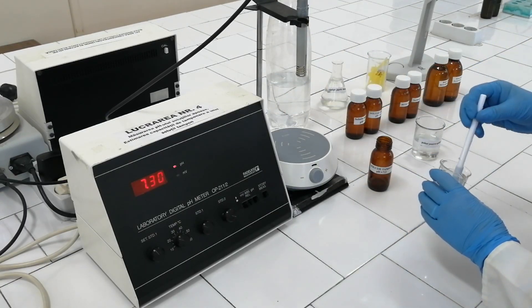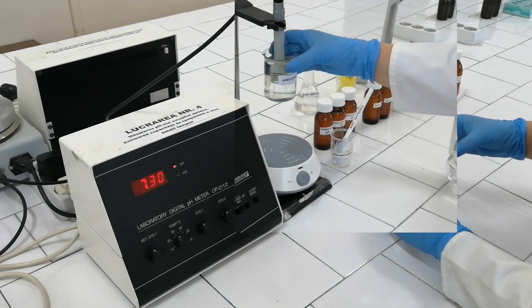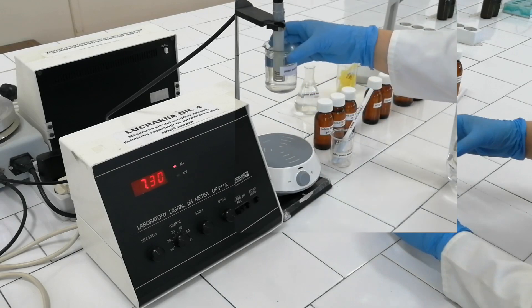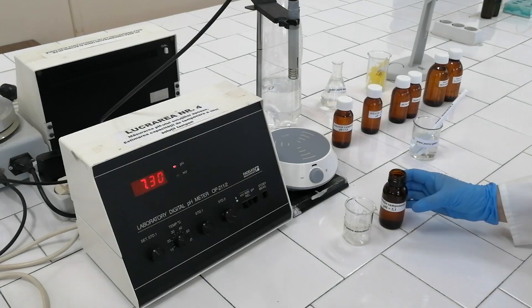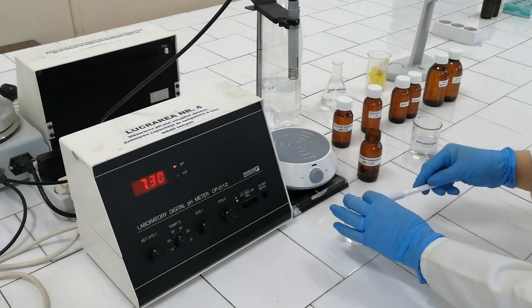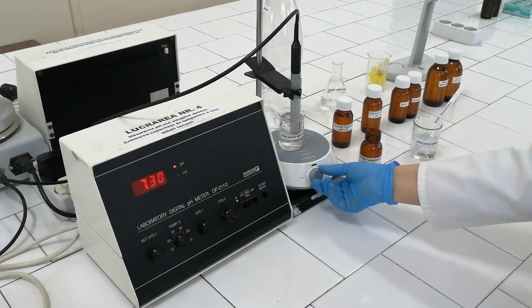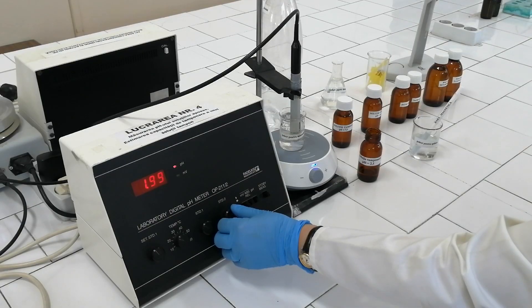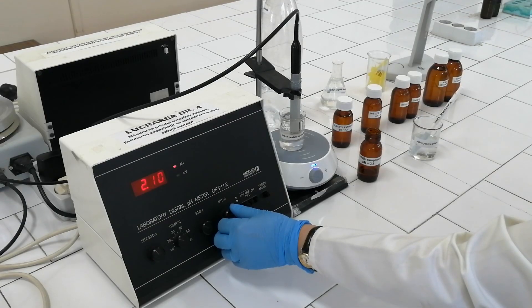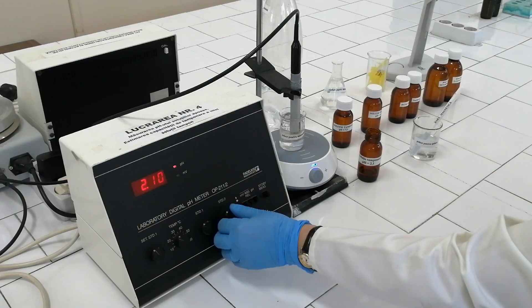Don't discard the standard solutions — pour them back in their containers. Continue by rinsing the electrode and the Berzelius glass well with distilled water. Always do this whenever you plan to change the solution in the Berzelius glass. Pour the second standard solution of pH 2.1 in the glass, place it on the magnetic stirrer, and dip the electrode into the solution. Set the measuring working mode and rotate the STD2 button until the value 2.1 is observed on display. Set again the standby working mode, take out the electrode, and pour back the solution in its bottle. At this moment the pH meter should be calibrated for measurements in the acid domain.